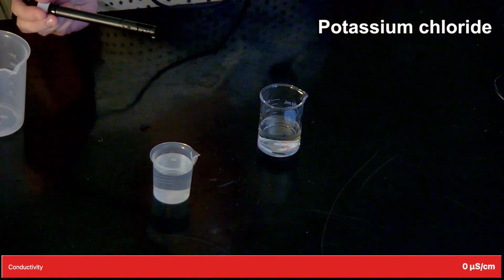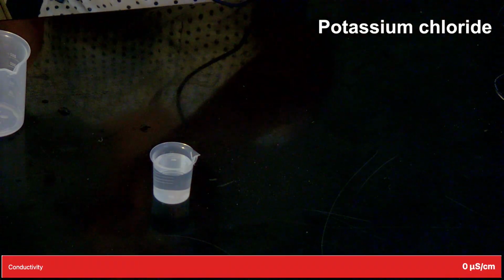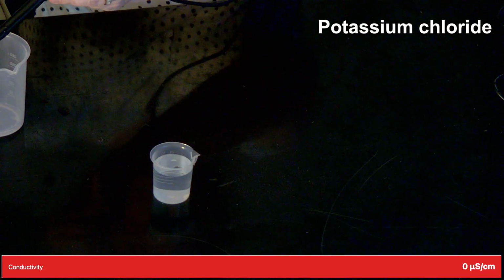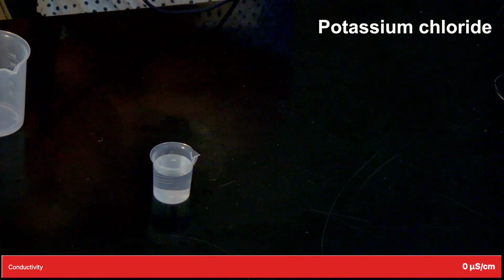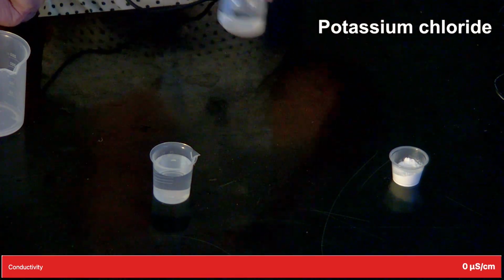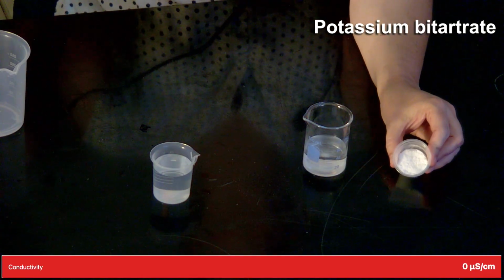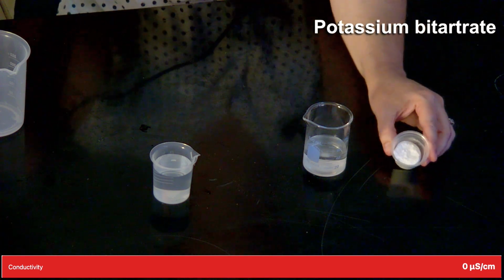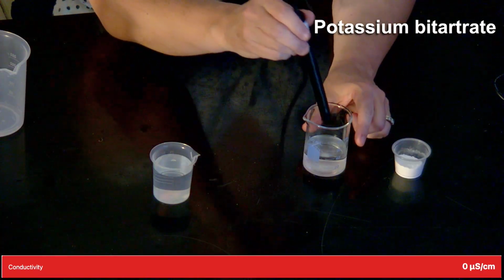Between each trial, I will need to do a quick rinse of my probe just so that I don't contaminate solutions. So I'll use some distilled water and then do a quick clean off of my probe. The second substance is potassium bitartrate. And this one's also a white solid, but it is a little bit more pillowy, less granular. And I've already added it here to my beaker. So I'll insert the probe.